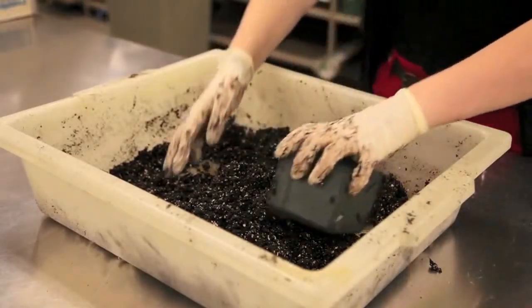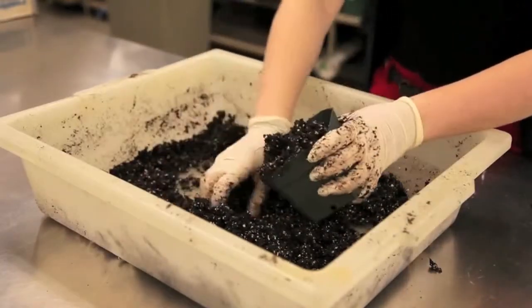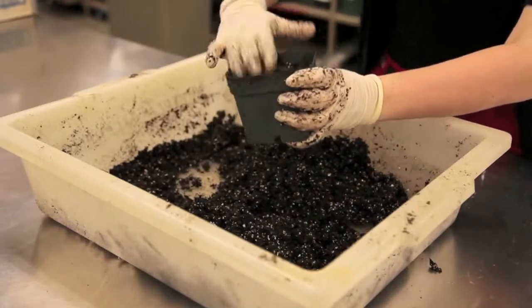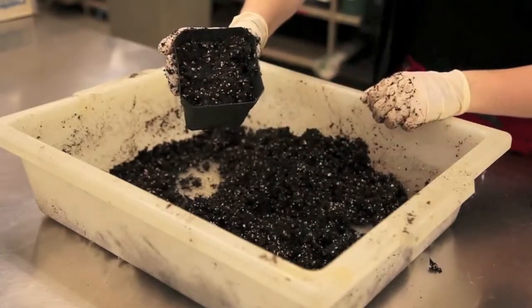Next, you should scoop soil into each pot. Try to use your hands to pat down the soil. Your goal should be to fill each pot all the way to the top.